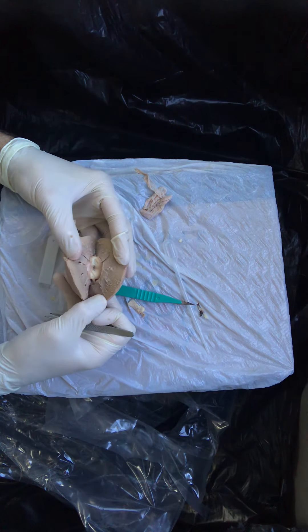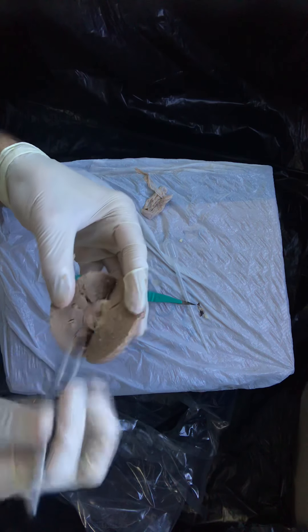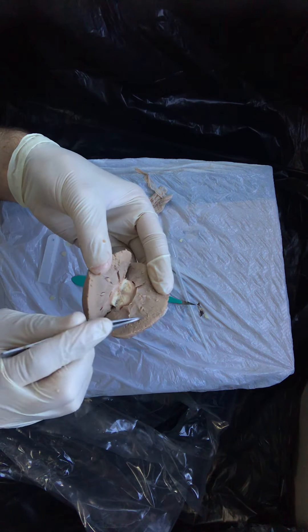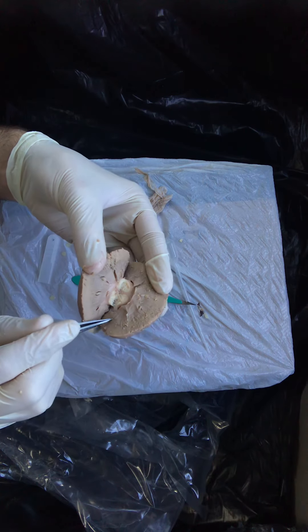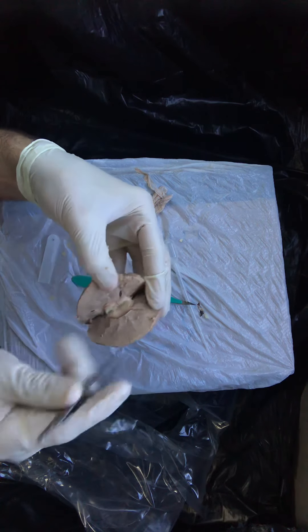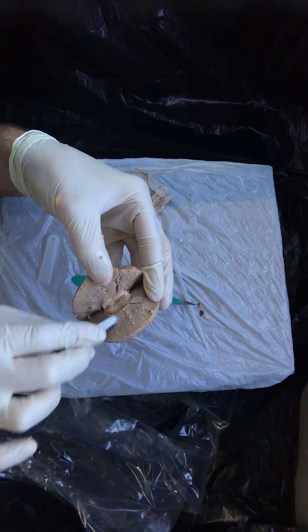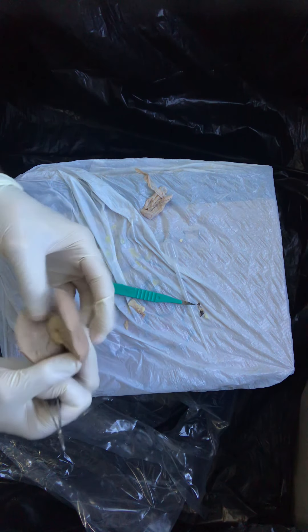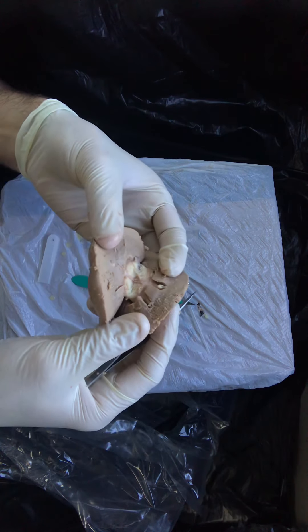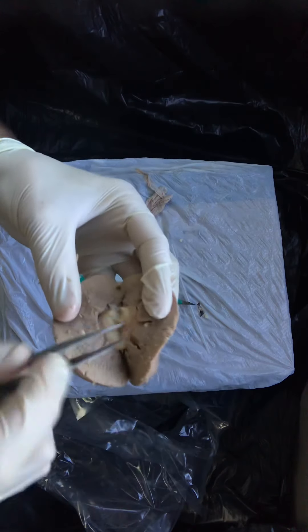When you look at your cut edge of your specimen, the renal pyramids are here. They are not as obvious as in the textbook, but you can see a corticomedullary junction — that's the boundary between cortex here and medulla right there. You can as well in certain areas see these extensions of cortical tissue extending from superficial towards deep, or from the periphery towards the renal pelvis. Those are the renal columns. And depending on your location of incision, you can really start to see something like this — a natural separation between these tissues.